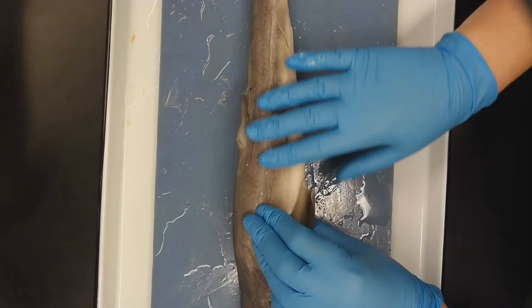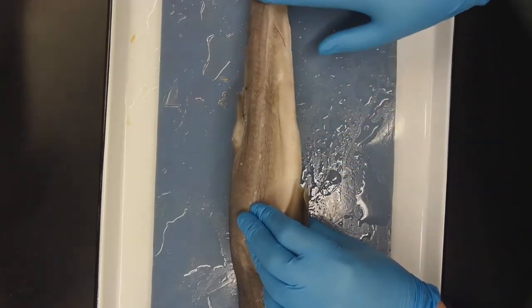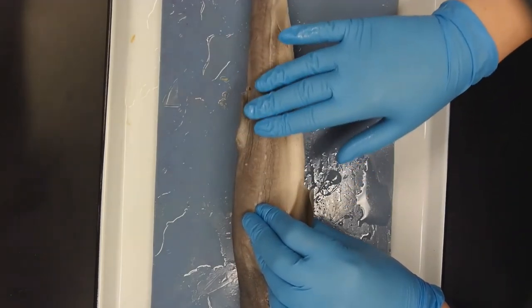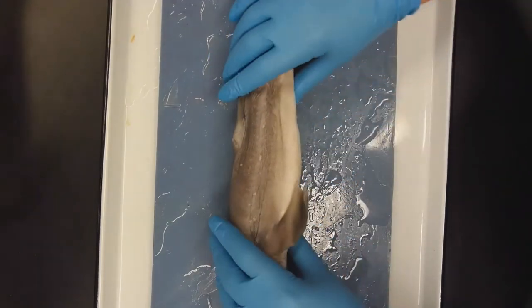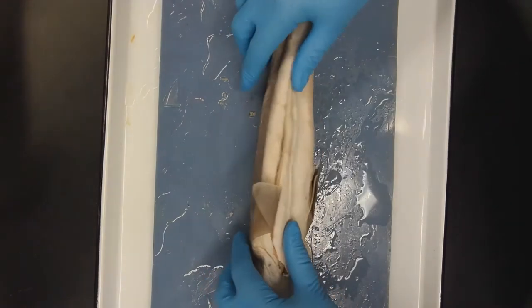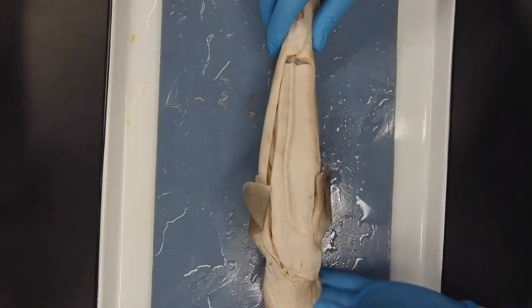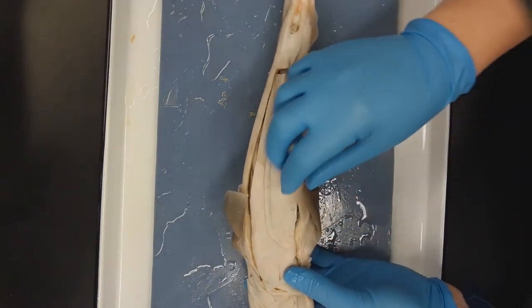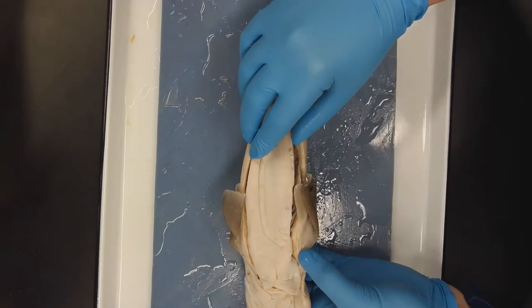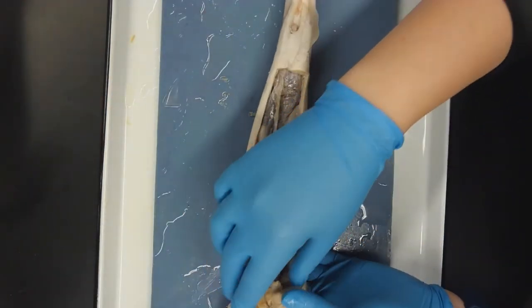They have specialized placoid scales which are built into the dermis, almost like a tooth. If you run your hands along the scales, the dermis feels smooth, but if you go against the layering of the scales, the epidermis feels like sandpaper. Now I've already pre-dissected the shark to reveal the major structures we're going to talk about today.